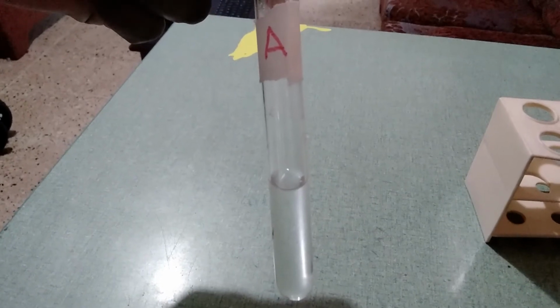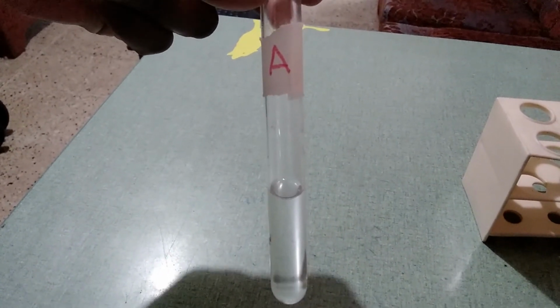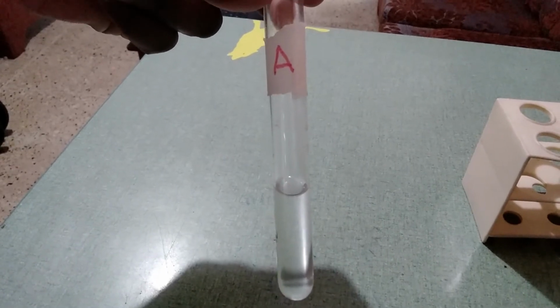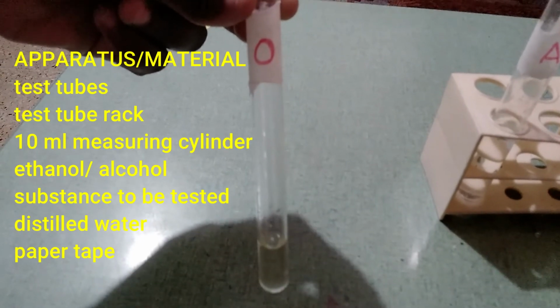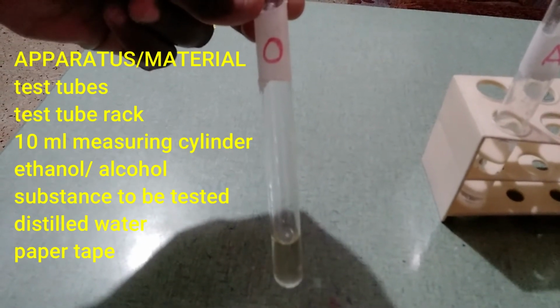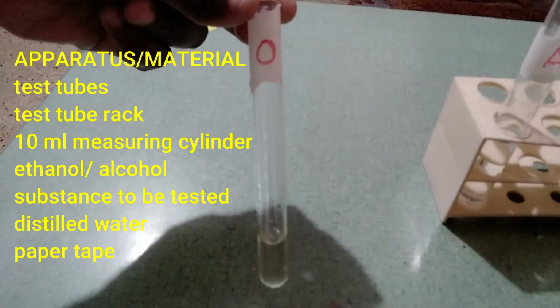There we have the tubes labeled. Label tube A has alcohol or ethanol in it. Label tube W has water in it, and label tube O has oil or the food substance to be tested in it. There on screen we have the apparatus and materials to be used.